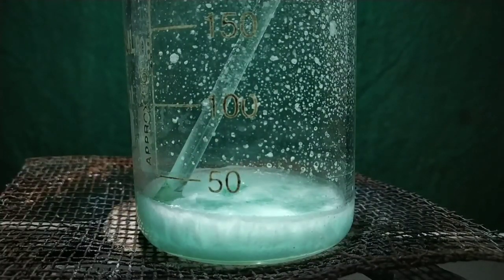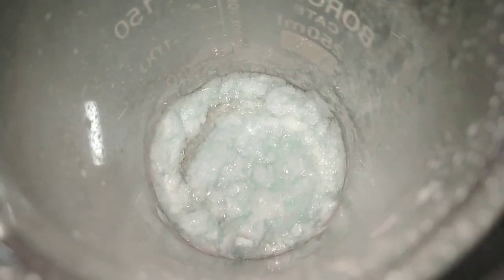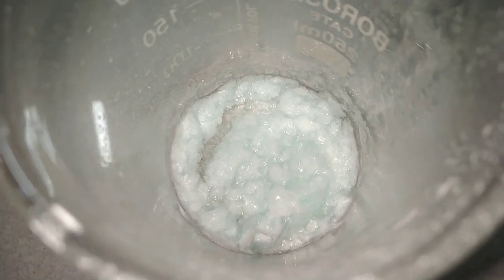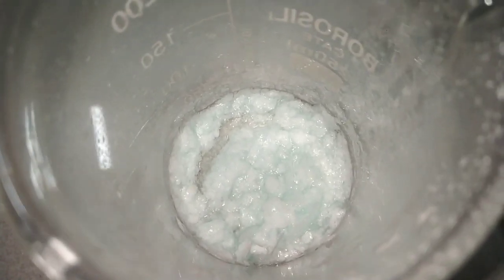Now the real task is to remove the green solution and isolate the white crystals. You can see the white crystals of silver nitrate and in between you can see the green to blue color of the contamination.